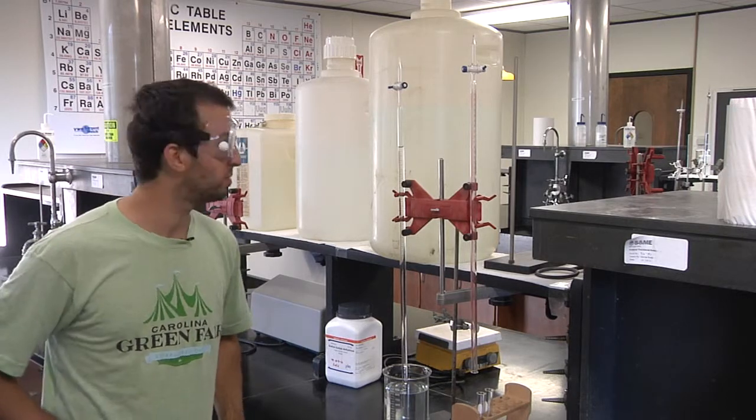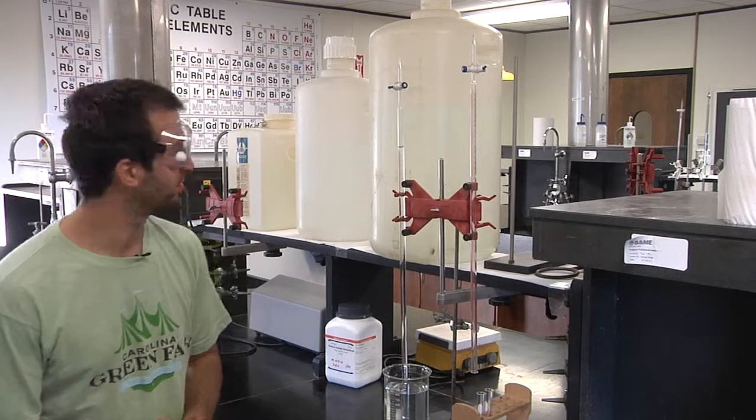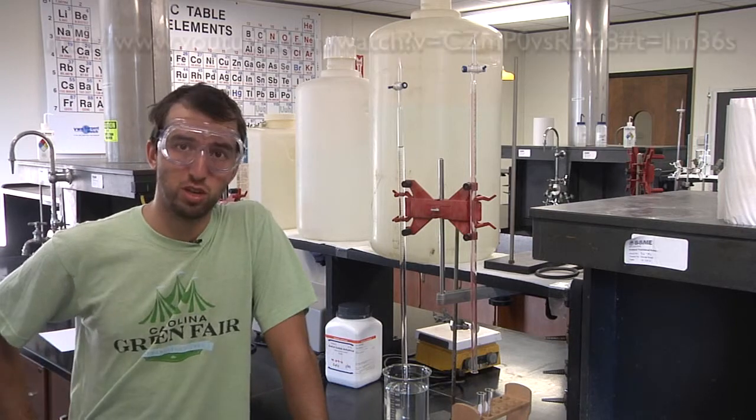It's very similar to the siphon effect. Have you ever used a siphon? That's how they work. Yeah, that was a rather mediocre explanation, but if you want more information about siphons and pressures, click here.